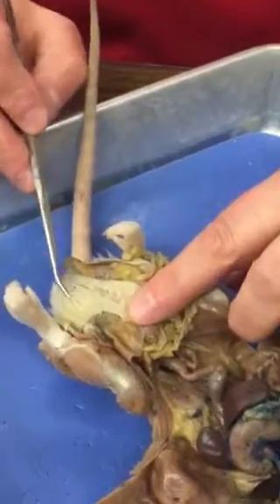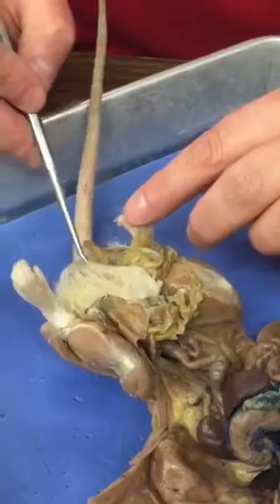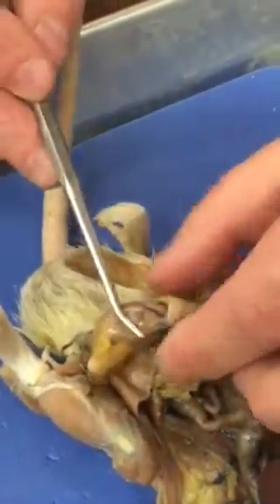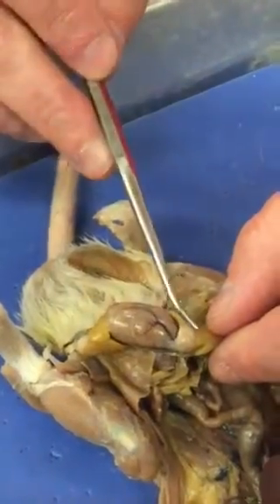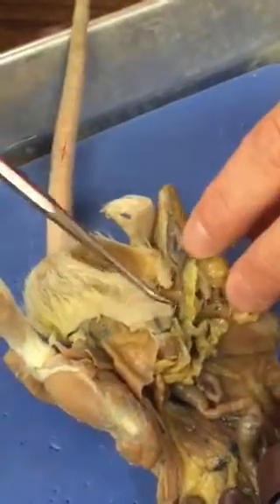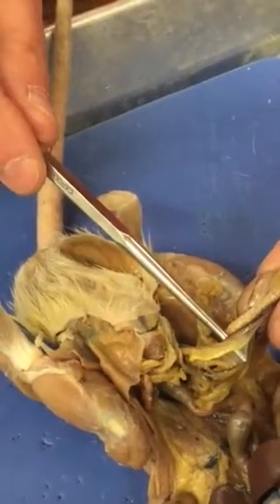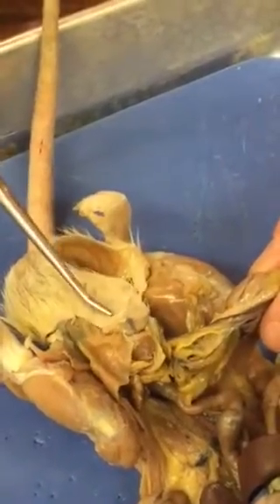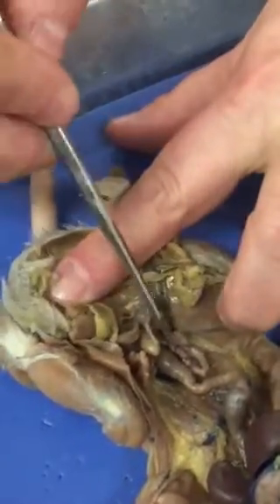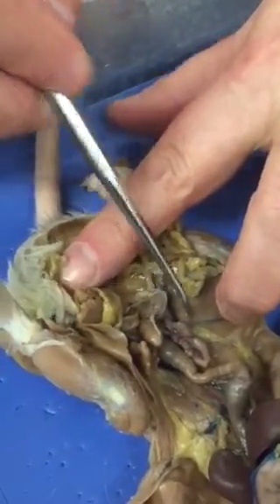On a male, you first need to know that the skin on the outside is called the scrotum. And then if you remove a testes from inside, you have the epididymis on either end and the testes. And then you have the vas deferens, which is the tube that carries sperm out of the body, again through the penis. And again, don't forget that on all four corners of the bladder, you have seminal glands.